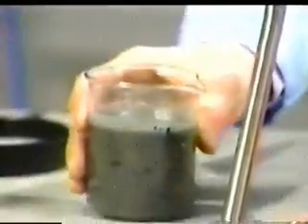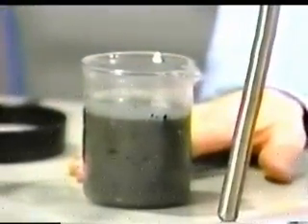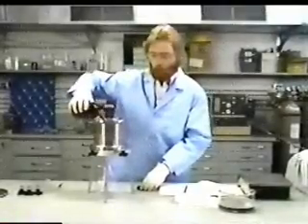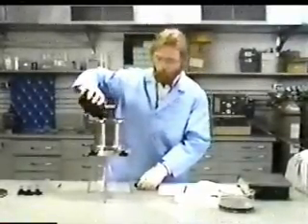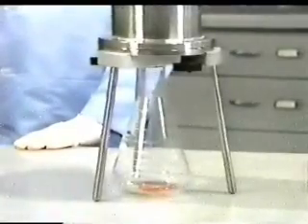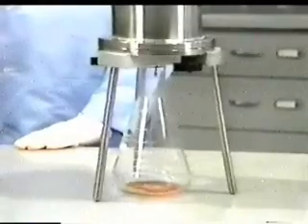To demonstrate, Method 1311 is applied to a synthetic waste consisting of a solid phase and a liquid composed of both aqueous and non-aqueous phases. The initial filtration step of Method 1311 separates the solid and liquid portions of the waste. Here the filter models the layer of soil immediately underlying the landfill. In this example, the initial filtrate contains a yellow oil phase and a red water phase.